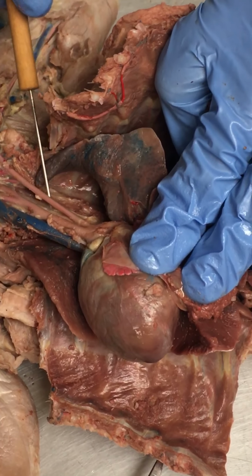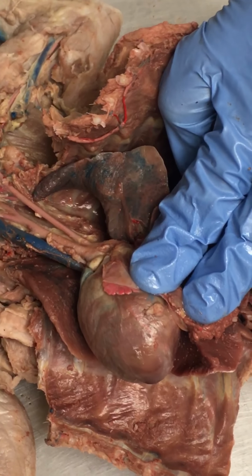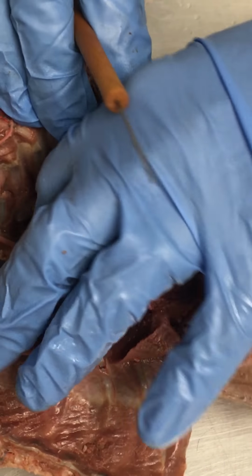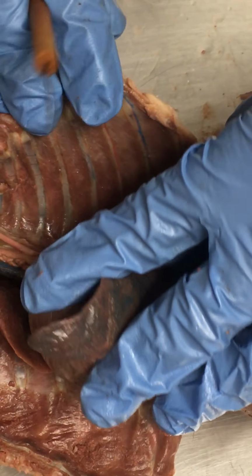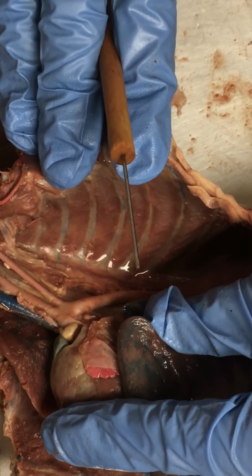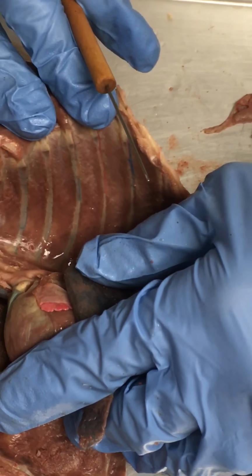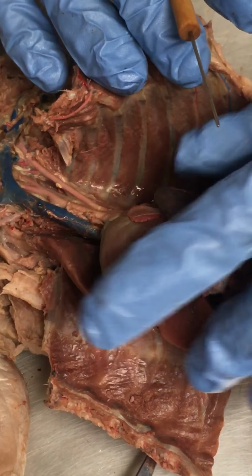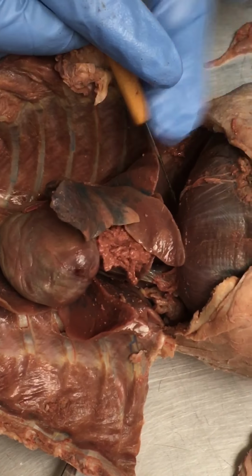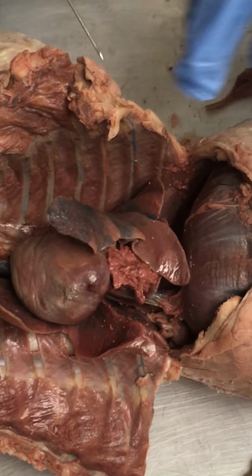We know it's the aortic arch because these two major arteries branch off of it. Just below that, we've got the thoracic aorta. It's just a continuation. Again, it'll be hard for you guys to see with my hands in the way, but you can see that aorta just continues on down and heads towards the diaphragm. That's the thoracic aorta. I also have abdominal aorta on here. That was my mistake, I should have put it on the next page. That's once the aorta goes through the diaphragm and comes out the other side. So we'll get him next lab period.